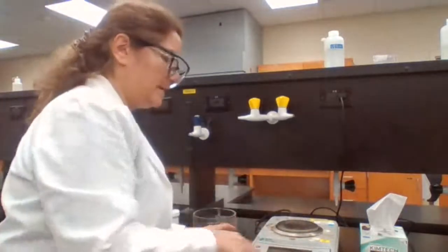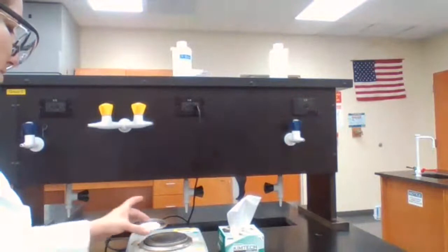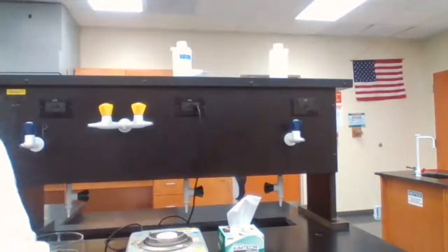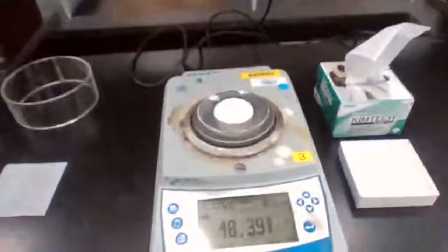So first here, then place the watch glass. Take a screenshot.